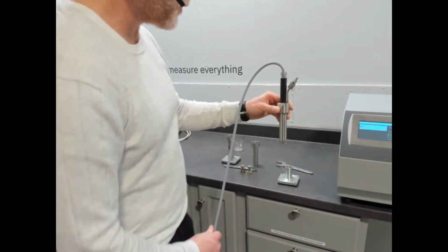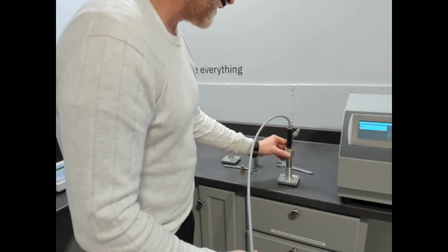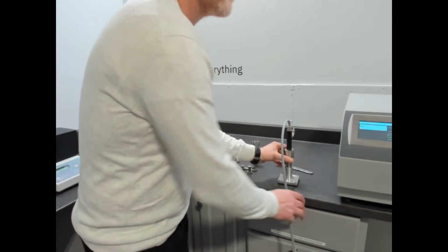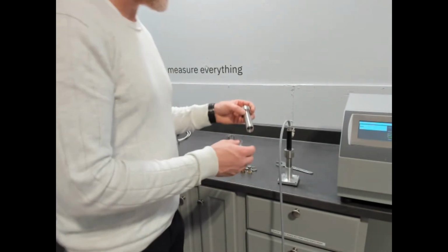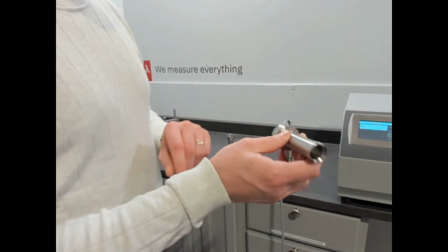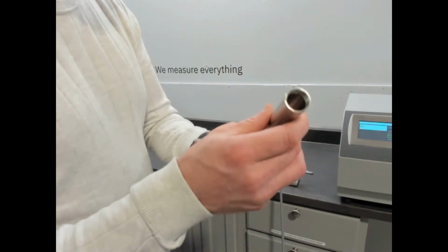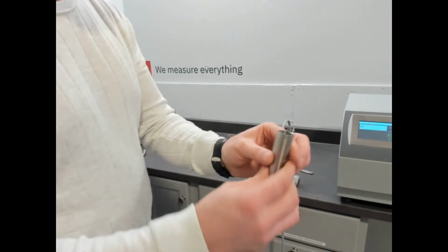Before we go over and put this into the temperature platform and connect it to the MP-1, I wanted to show you something. These are the additional cells that you can get with it. You'll see from the demonstration that we mentioned phase change materials. In this cell, it's completely open. And what you do is you would insert your sensor upside down.